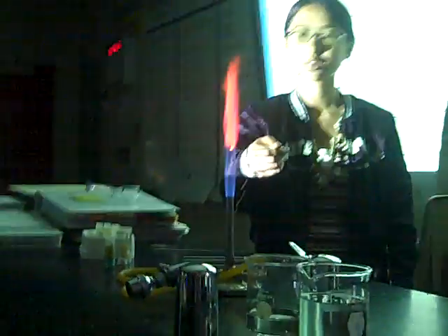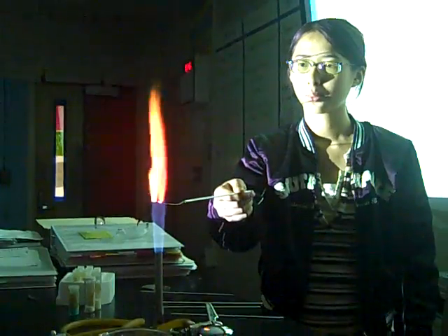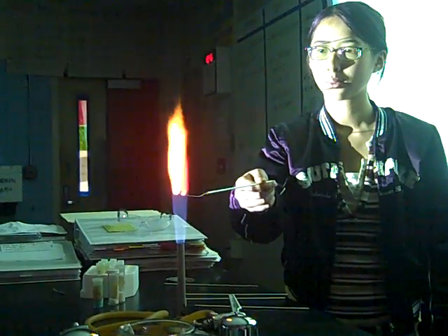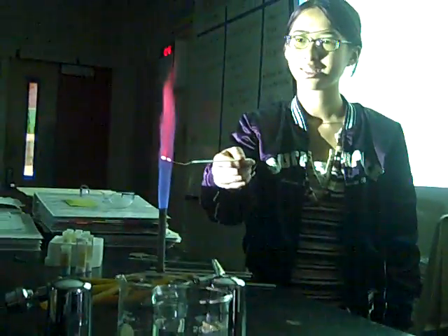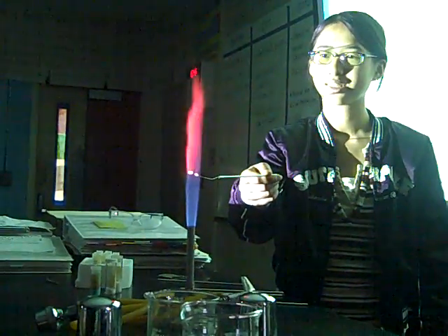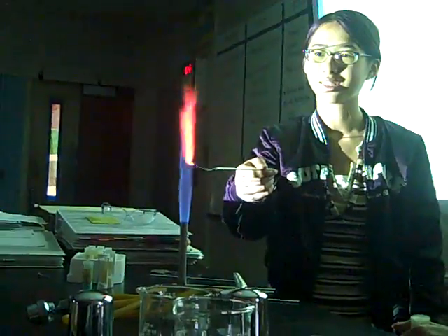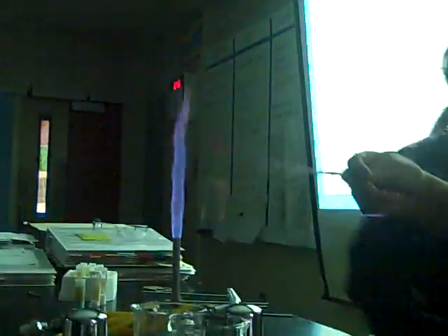Lithium chloride. What do you see? It changes colors. Write down your observations. Like a red orangey, red orangey. Yellow, red orangey. It's really good. Purpley. All right. Thanks, Payne. Woo!